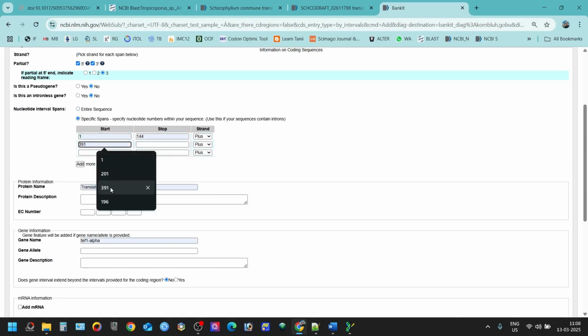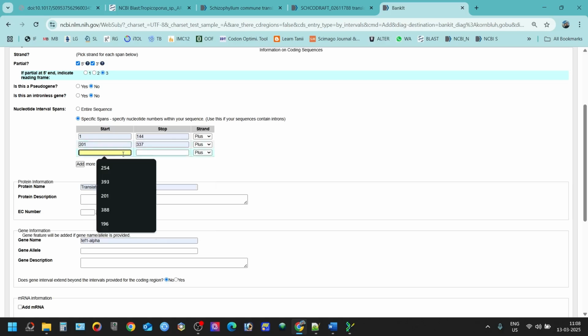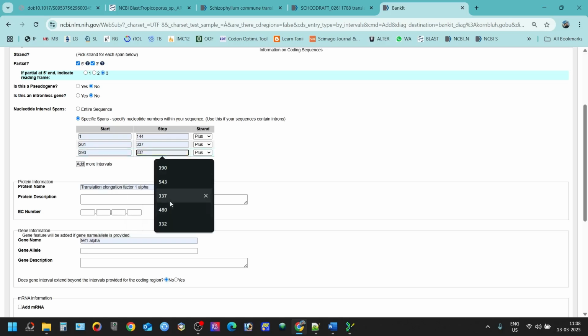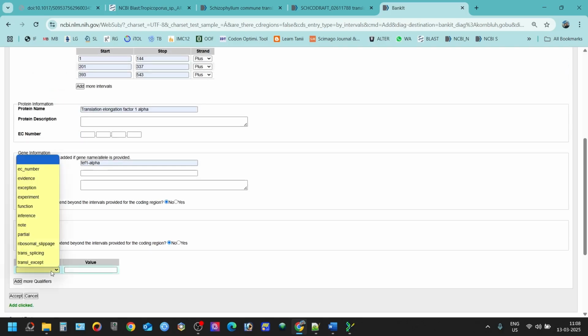Since it is not showing an error in my case, I'm just working, so it is good for me. But in some cases, if the error shows, you just have to change the open reading frame. Okay, you don't have to do anything else, you just have to change the open reading frame.